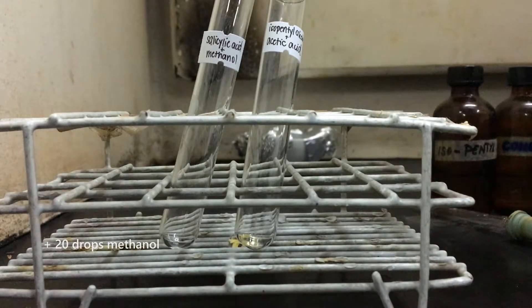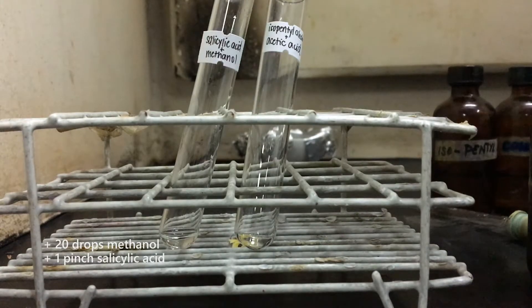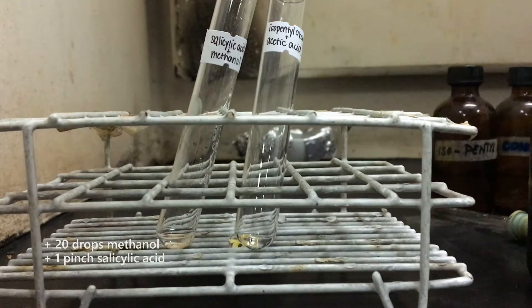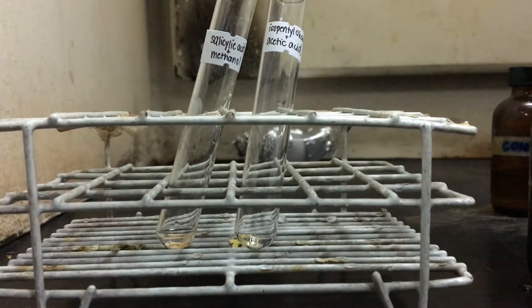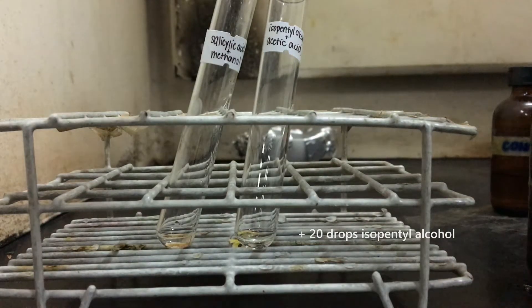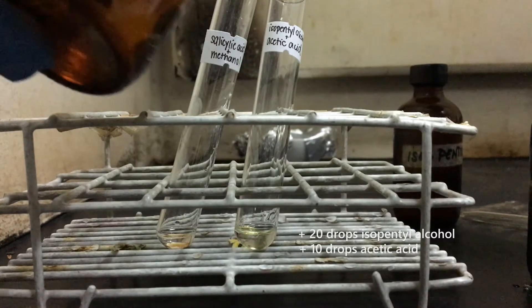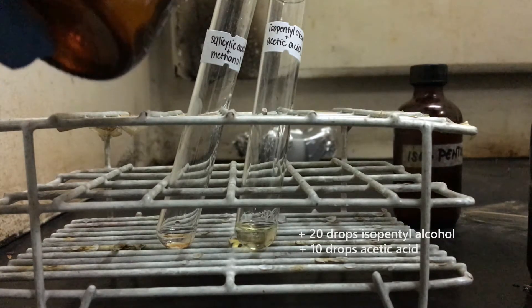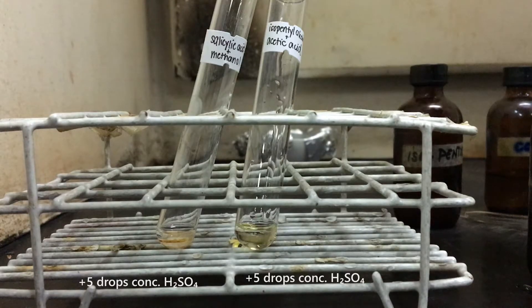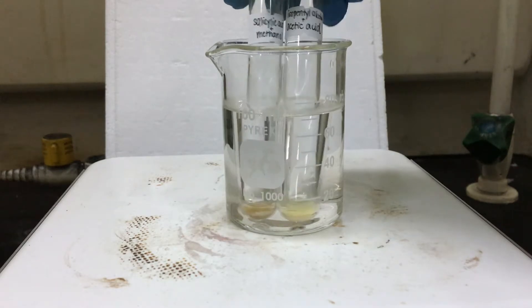First, we combine our samples and a select choice of alcohols in 10ml test tubes. Add 5 drops of concentrated sulfuric acid. The mixture is then heated in a hot water bath for 5 minutes.